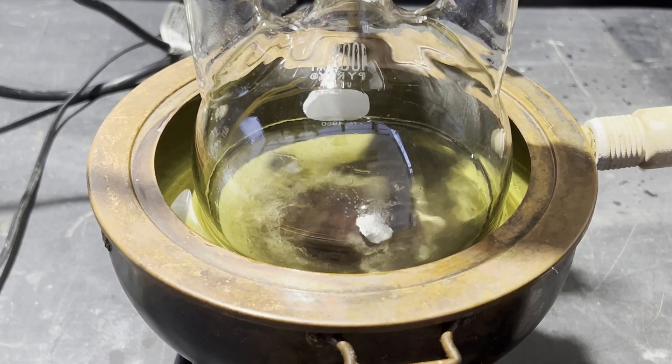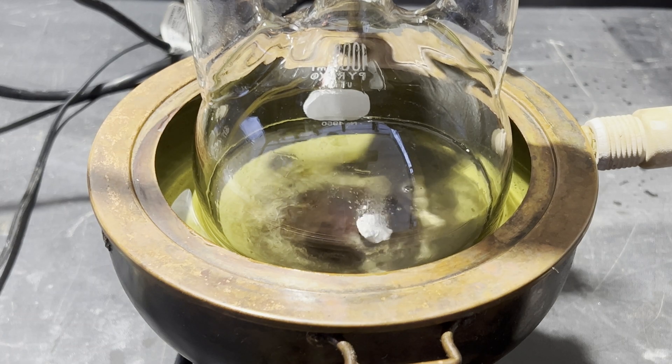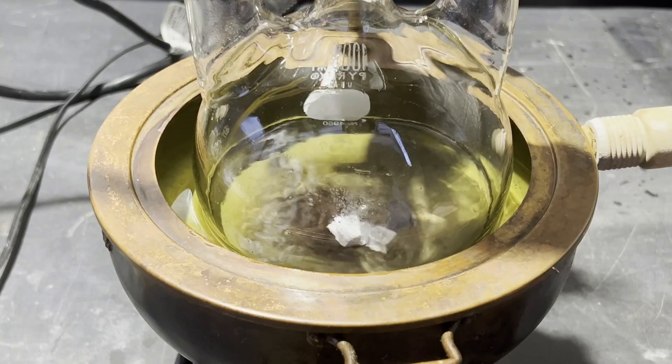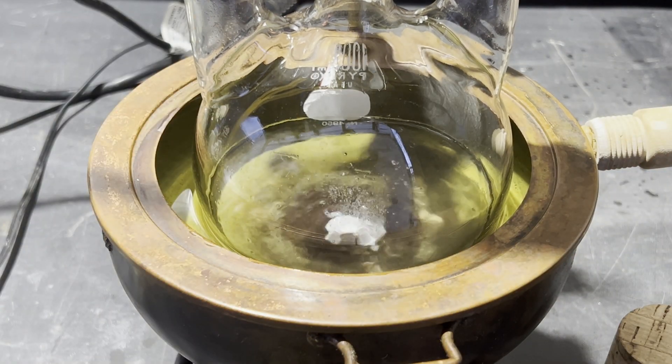I also use my super nice, special ethanol with no denaturants. Once the ethanol is added, I get the condenser and everything else set up, and then I start adding the sodium.